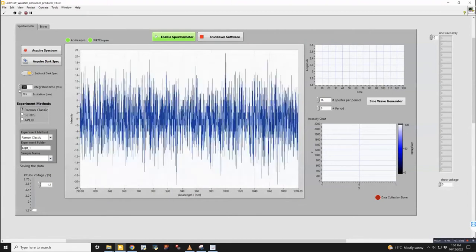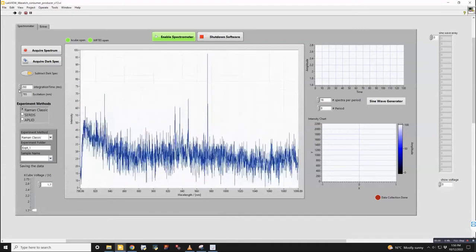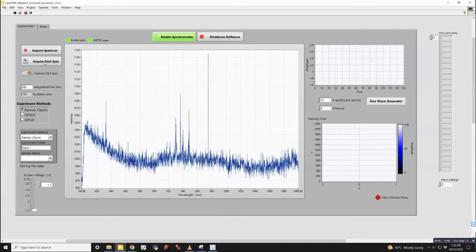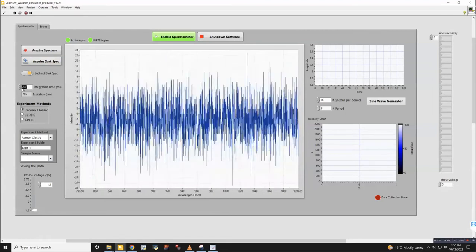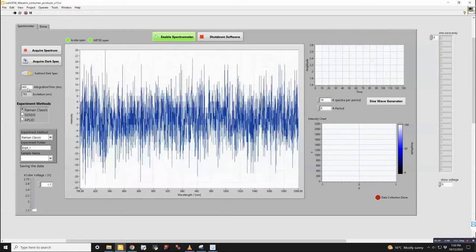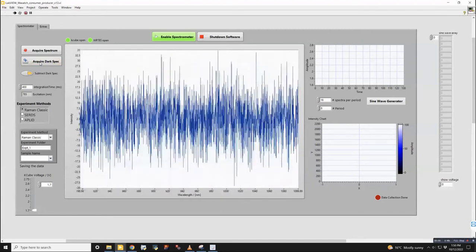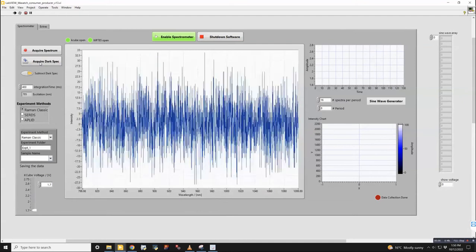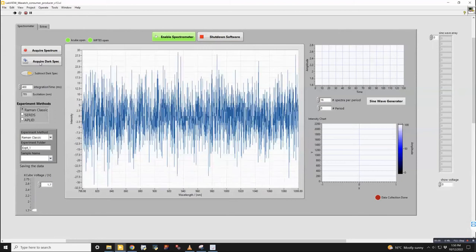So if I change the exposure time here to say like 200, what you'll see is that the dark spectrum is back because it doesn't fully subtract it. So what you have to do is acquire a new one and subtract it away. You should be able to just acquire it when it changes. So if I go to like 400 milliseconds, I should be able to acquire it here and then have it corrected.